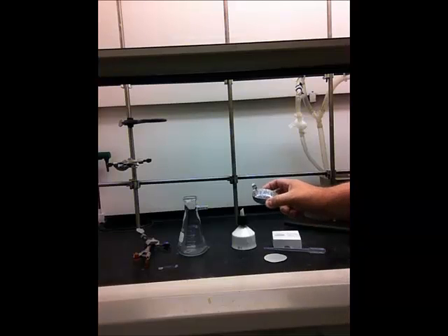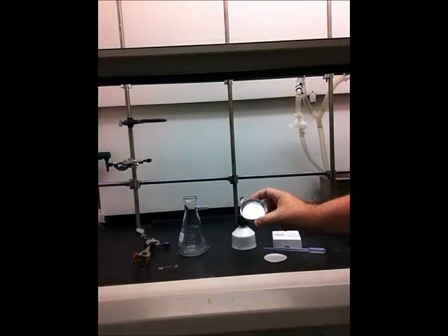When you're done filtering, you'll need a piece of black tubing to attach to the vacuum tube. Finally, you'll be scraping your crystals out into either a watch glass or an aluminum weighing dish before you dry them in the oven.